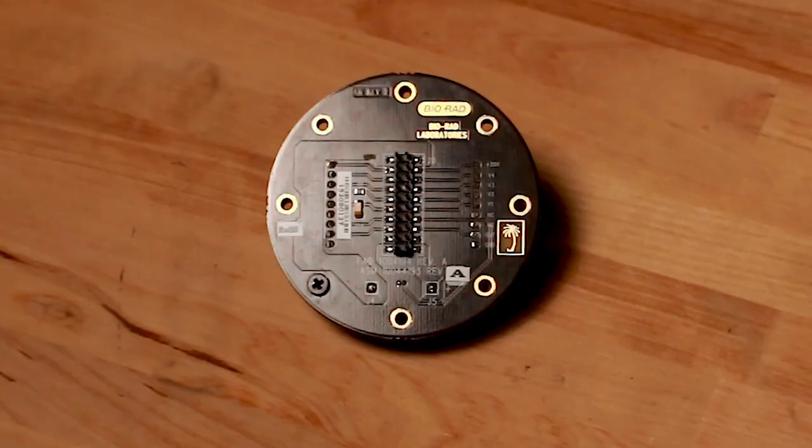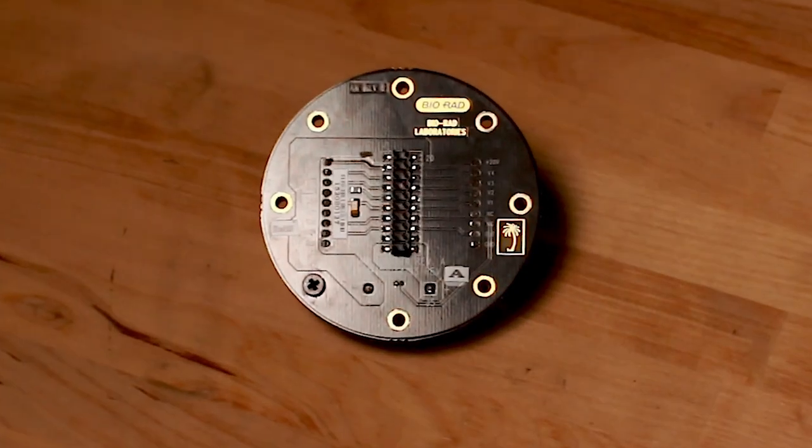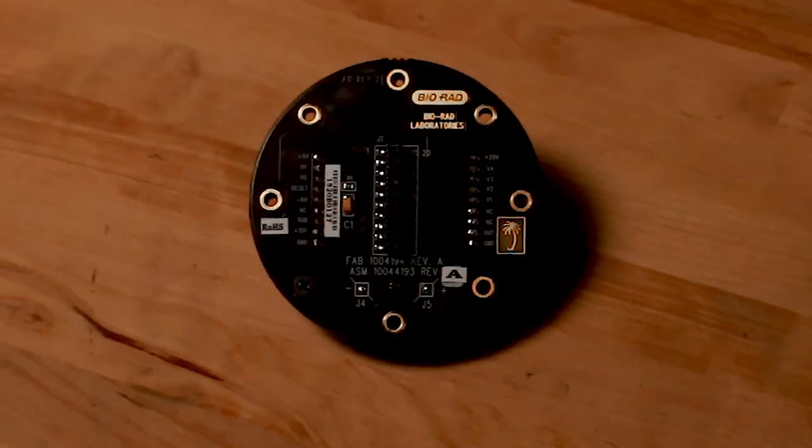The reason that our mechanical zoom and optical system is so good at taking pictures in low light is that it's flat-out optimized for it. It has a ridiculously low dark current CCD. It has a very fast lens that's optimized for just the spectral ranges that we're operating in. It has a zoom stage that can maximize for the smallest sample that anybody would ever use. You can zoom right in and take a picture of just that, or take a picture of multiple blots at the same time.